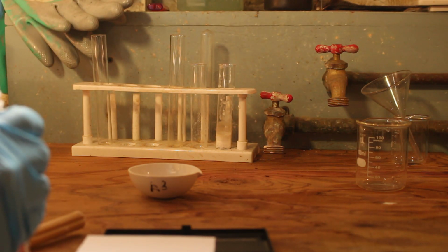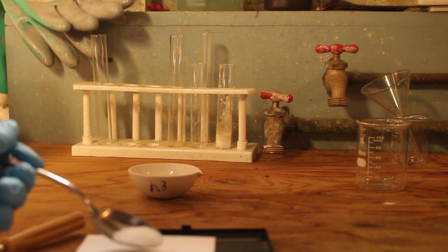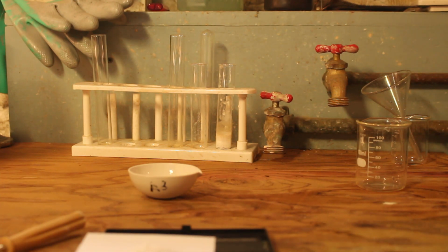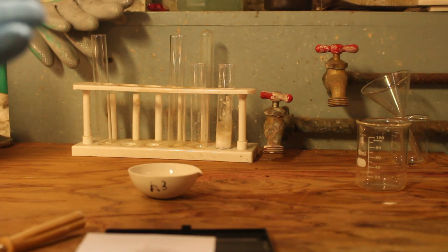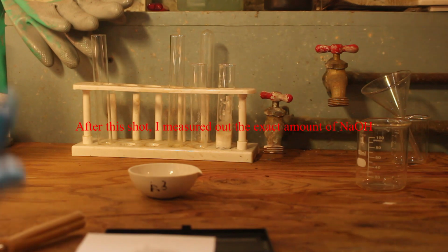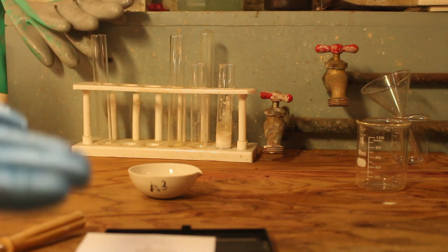And so we really don't need all that much of that. And there we go. We have way too much. I can pretend that that was exactly how much I want, but because it doesn't really matter, we'll be dissolving this all into water anyway, because it'll be aqueous. It will be fine being at 2.7 grams. Don't mind the noise in the background.